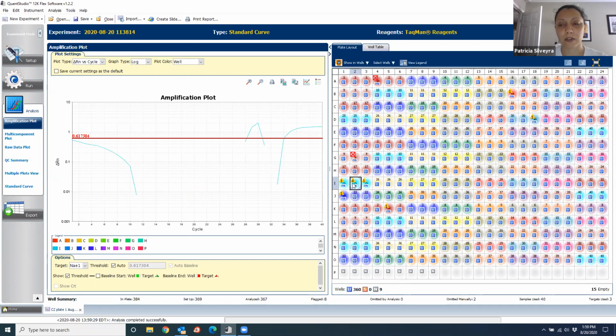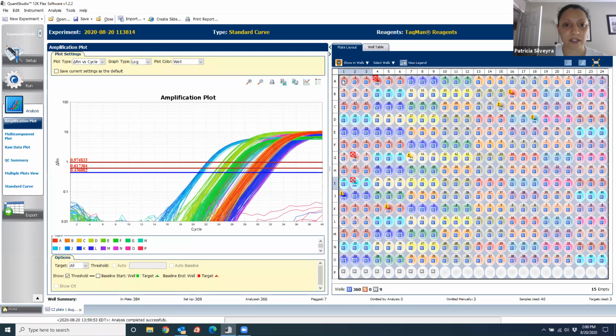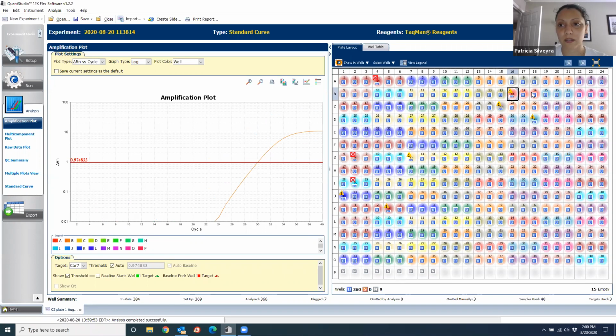So let's just focus on the one in the center: right click, omit, reanalyze. Sometimes when you fix one, the other 2 get fixed. See, now the triangle of error went away because the problem was that the 3 wells were very different, but now we removed the problematic one, the other ones went away. So that is fixed. And let's just identify if there's anything else very obvious over here. This doesn't seem very weird. This is fine, see, it shows a triangle, but I don't know why. Here, same, it's okay. So I will not omit those wells.